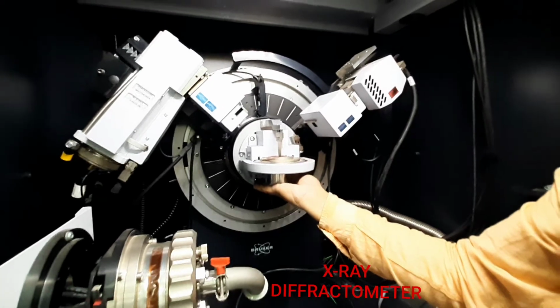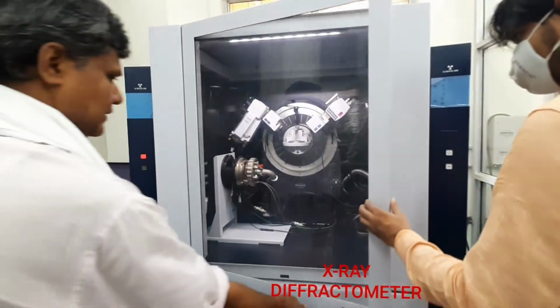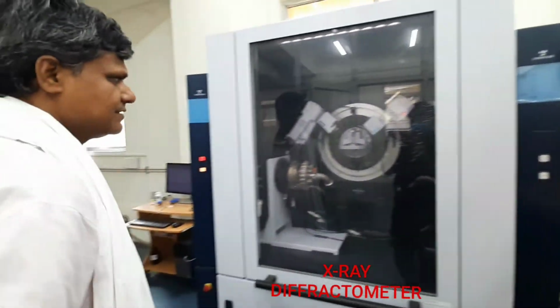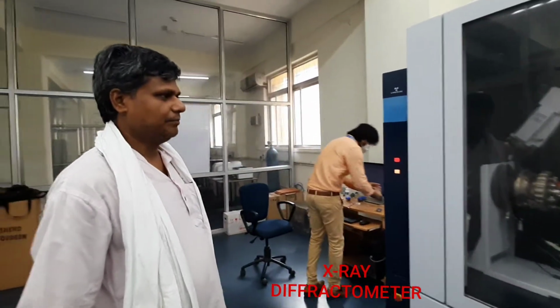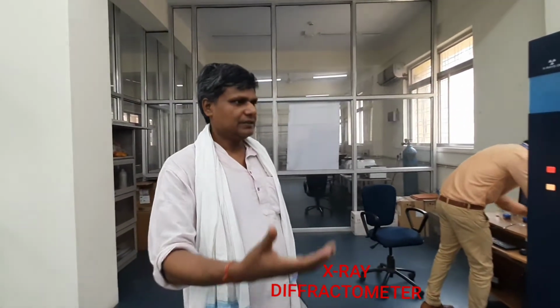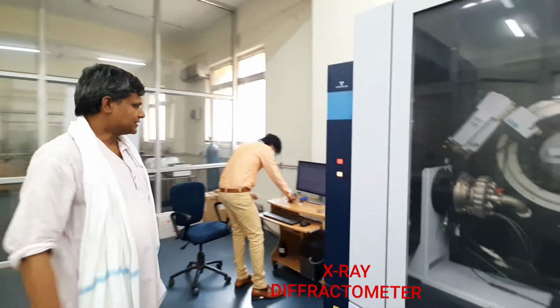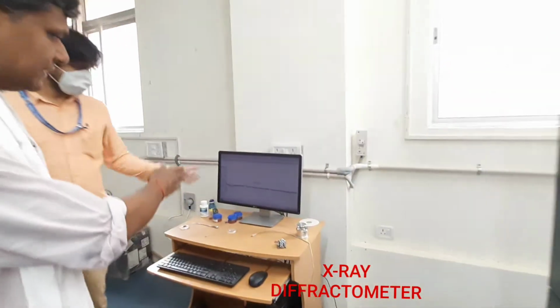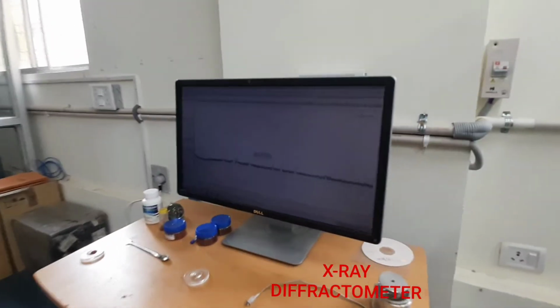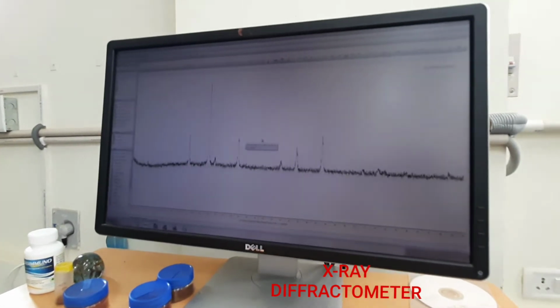Now the X-rays are being incident on the sample, and the pattern of this characterization result can be visible on this screen. You can see it. This is the X-ray diffraction pattern of this prepared sample. The sample is a magnetic material.